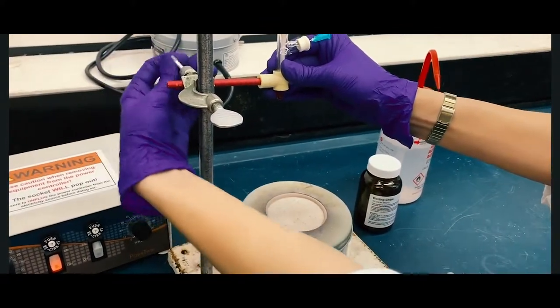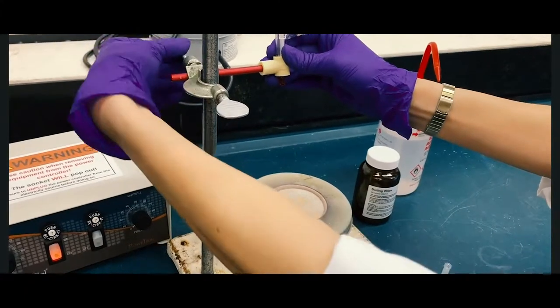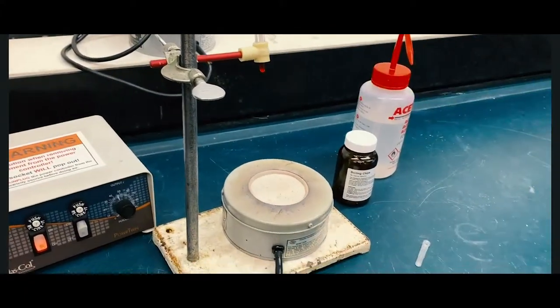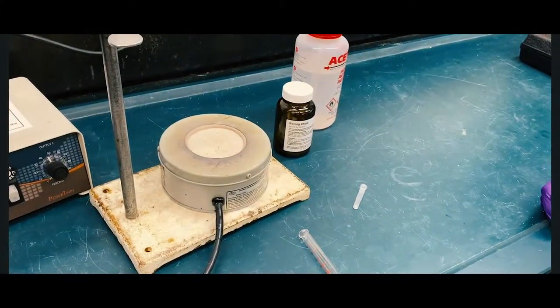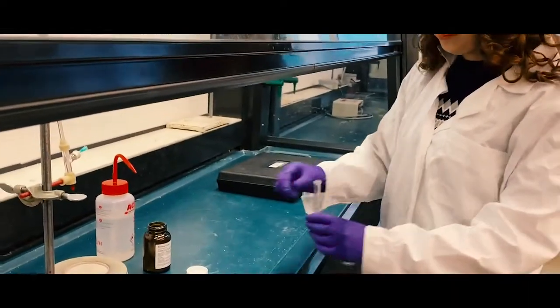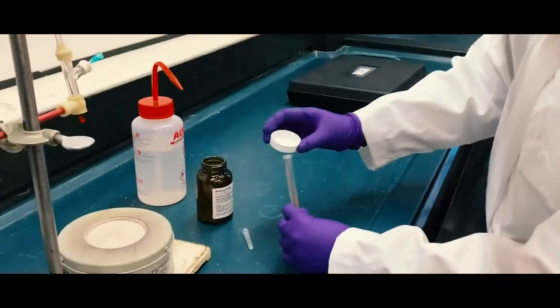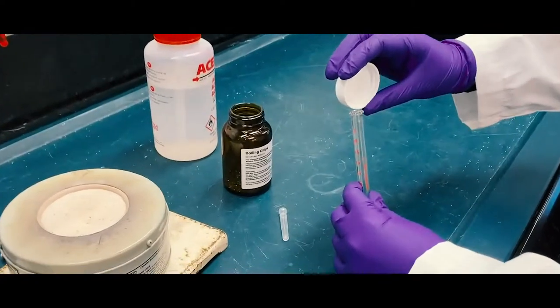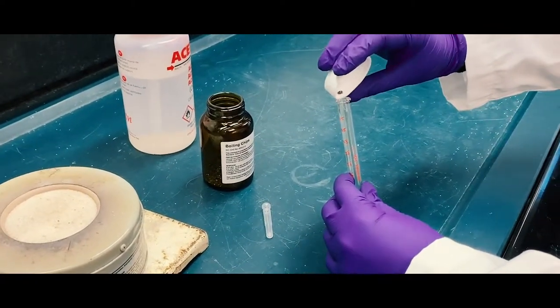Clamp it down, then prepare your solution. Add two to three boiling chips into the test tube.